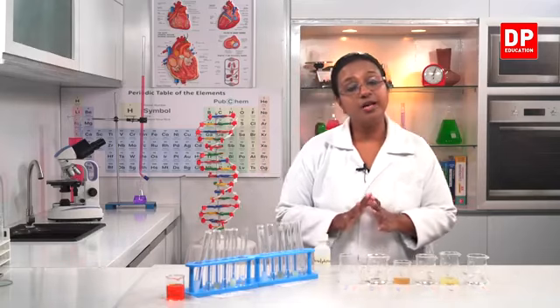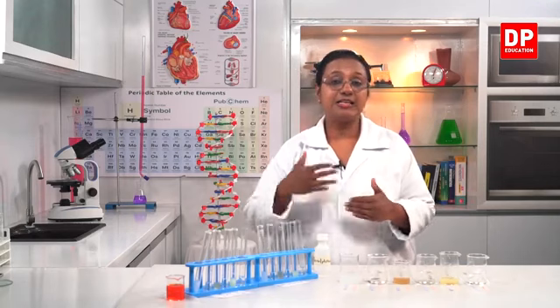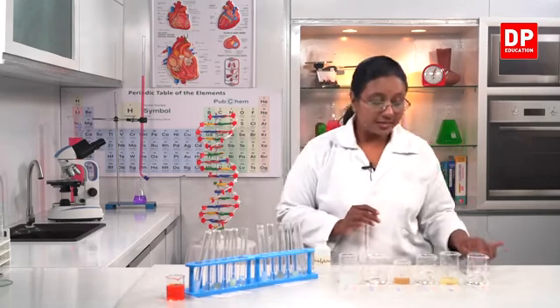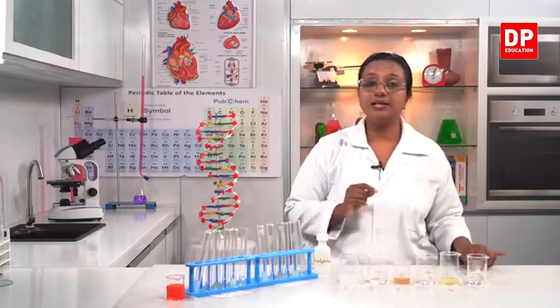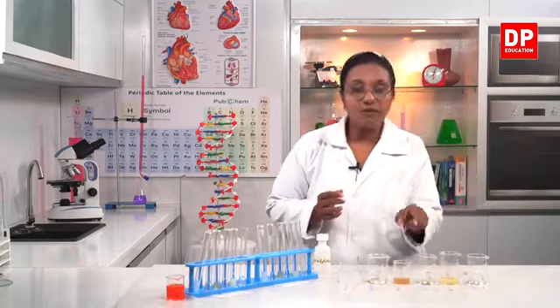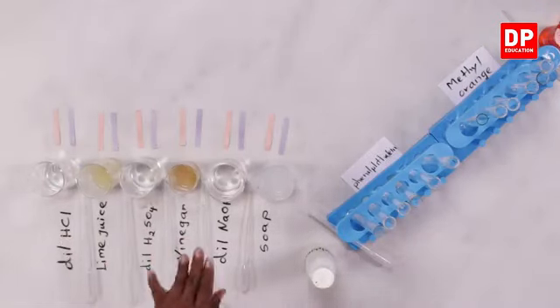So now we are going to test and see how these indicators give color with these acids and bases. So for that, first I will start with the litmus papers here. So I have arranged a set of litmus papers, both the blue and red for all the solutions.